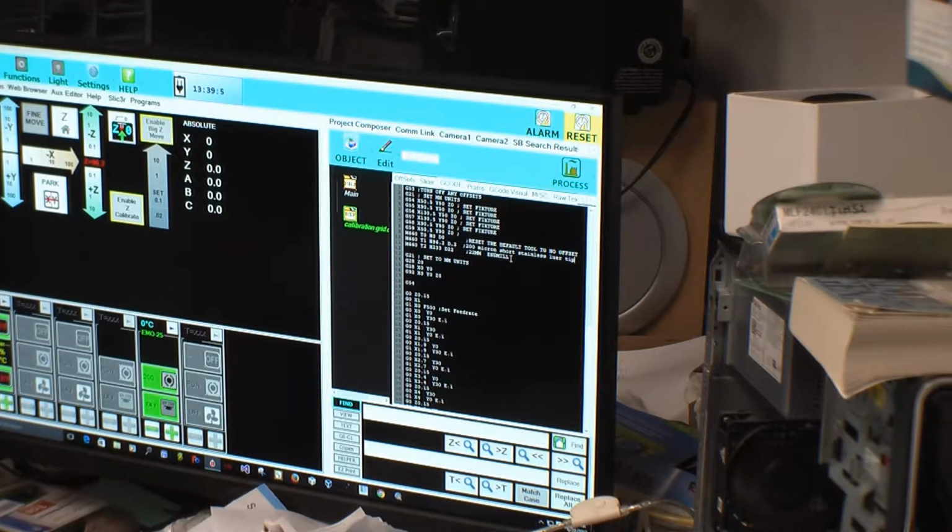Okay, and that's going to set that up, and when we hit the H1 down here, which is where we should go, see the G28, that's zeroing it. We really don't need to do that. I don't mind if we home it. We can home it. That's fine with me. And then right here, we're going to do a G54. And then we're going to do a G0. Well, we have to, yeah, we can do a G0. And we're going to go X. We got it right there.